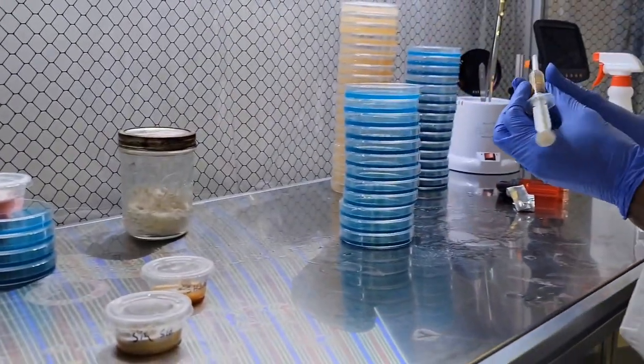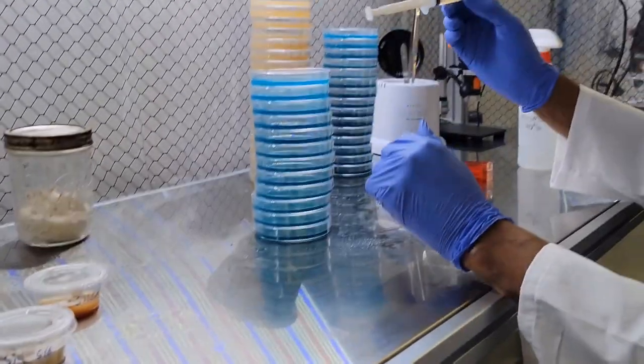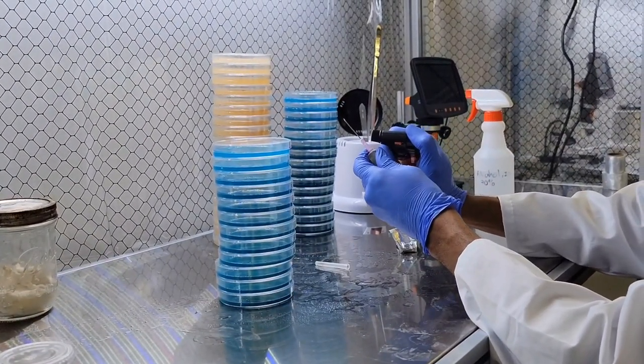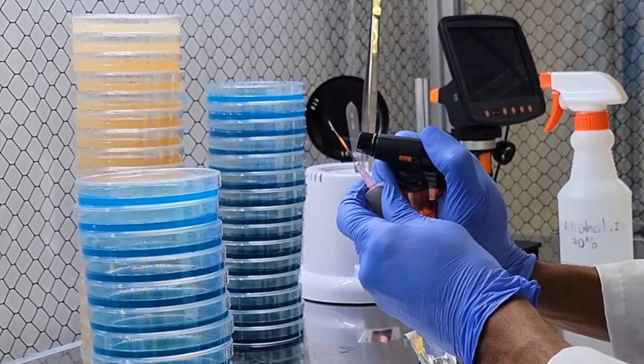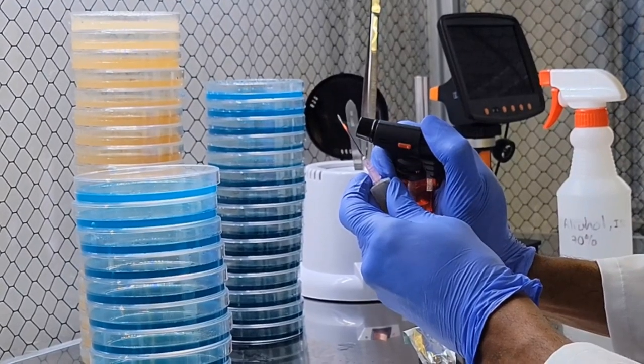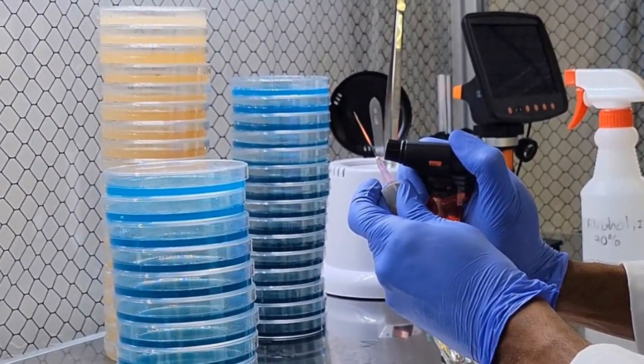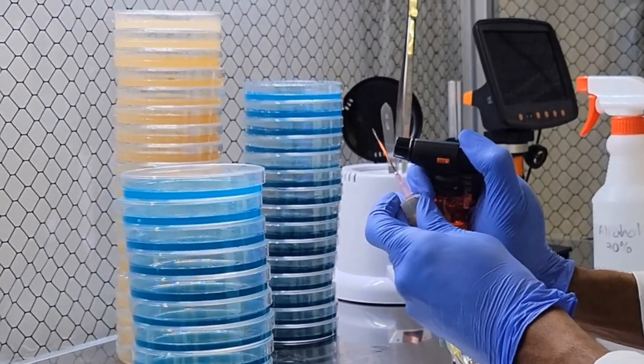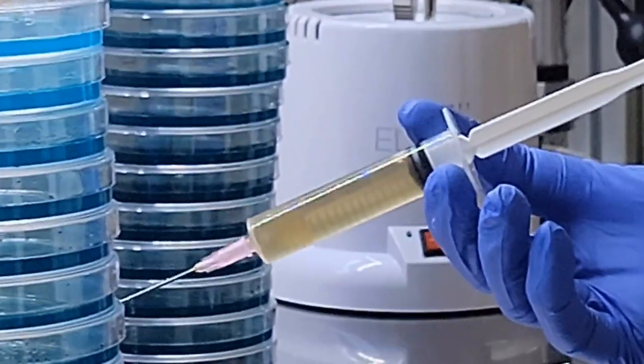We're going to do an inoculation of the lion's mane. Wraps off. Flame it right back down. Careful not to burn the plastic on the bottom of the needle.